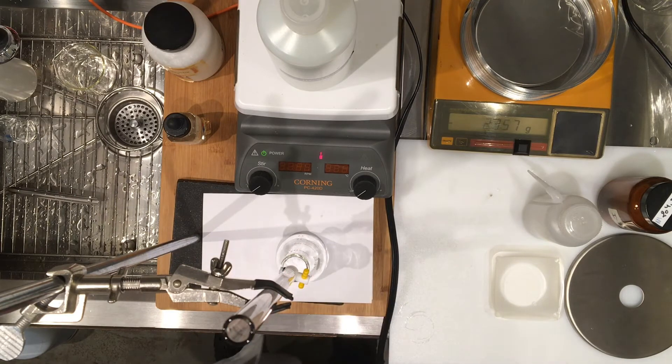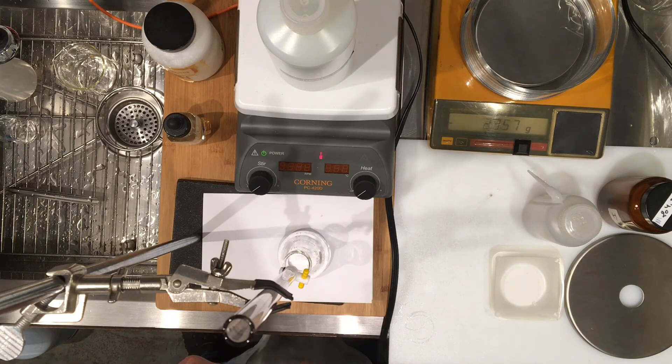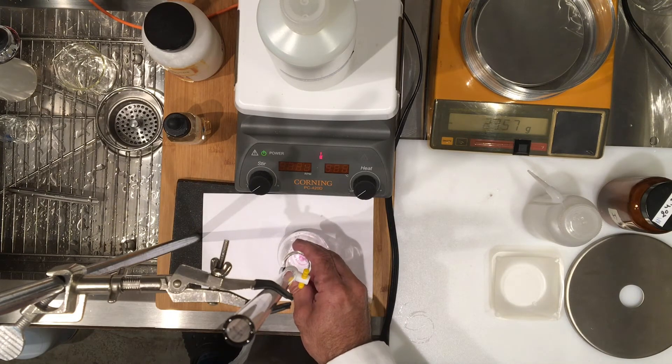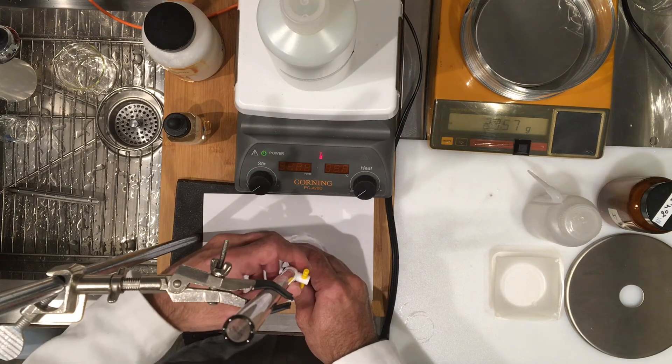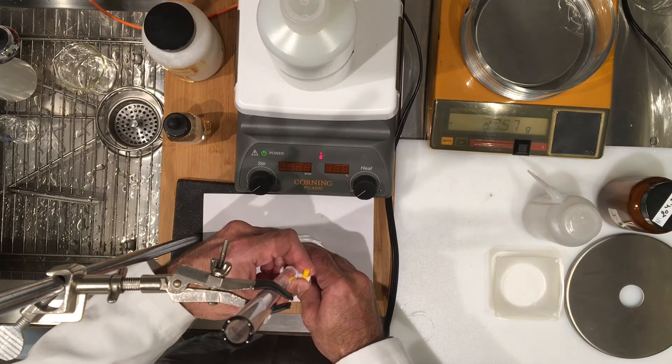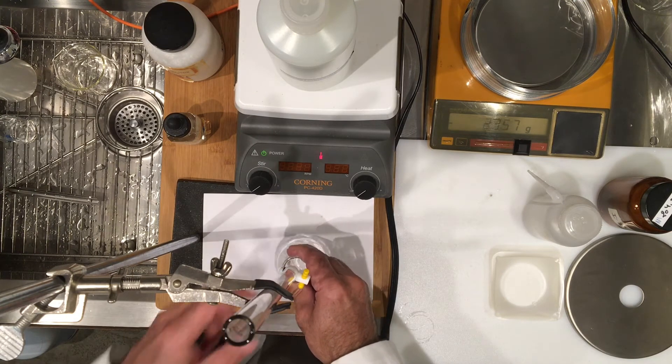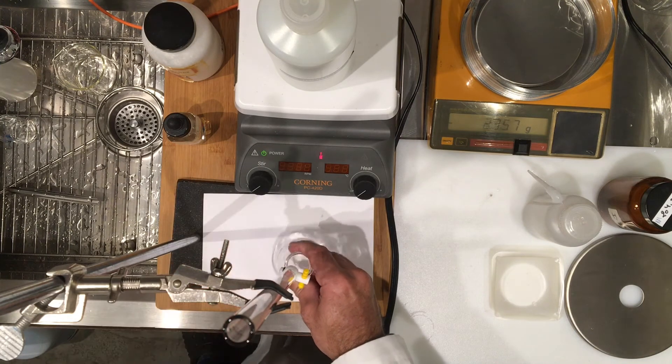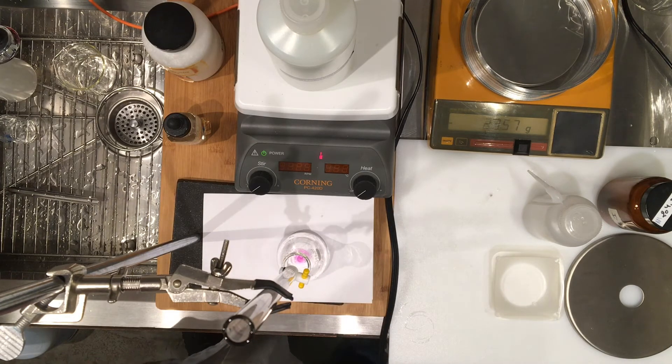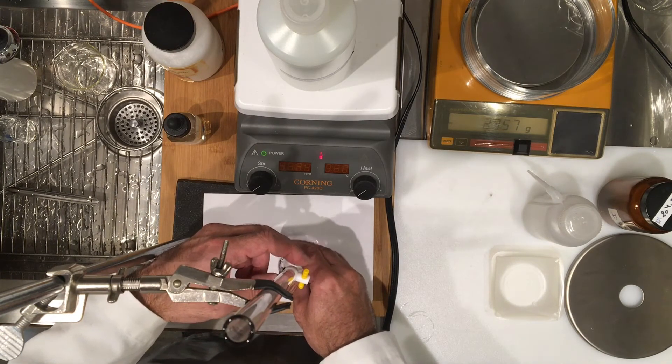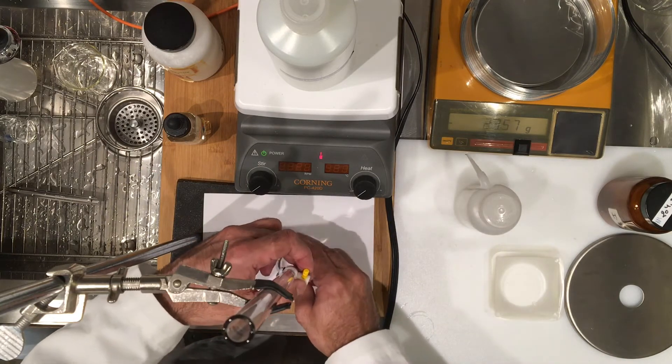I'm just going to let it go at this rate and see if I can hit it to the slight faint pink color. I'm making the drop rate a little tiny bit faster. These are really fun lab work and I wish I could have done this in the lab but I'm doing it for you.